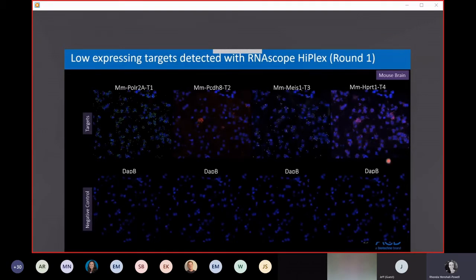Also, autofluorescence is the worst in the green fluorescence spectrum, always, regardless of whether you're doing a protein immunostain or in situ. So we recommend to put your highest expressing target into green to further optimize your signal to noise. So here, for instance, of these 4 targets, you can see Polr2a is the highest expressing. There's the most dots and the most signal. So that one was designated as the T1 probe, so it's detected with the green fluorophore at the microscope.